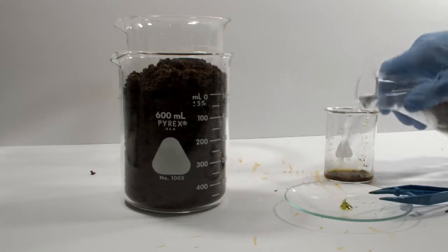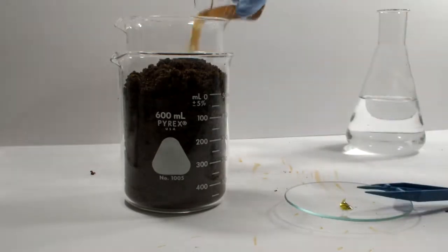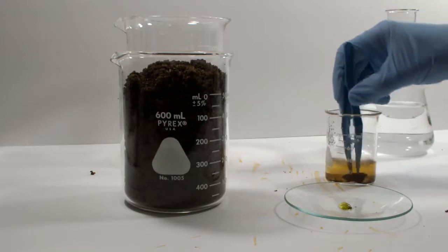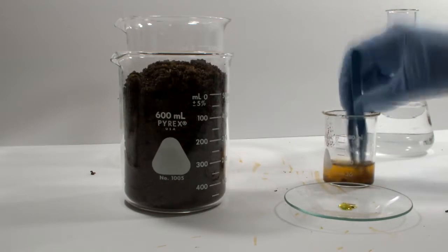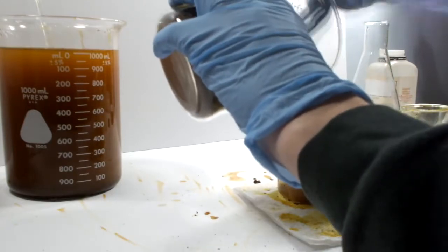This stuff is really soluble. I'm going to exchange the watch glass for a napkin, and I will spare you from filming the entire procedure. But eventually, I do turn this process into something that's relatively manageable. It's still a real pain, though. As you can see by my mess, I've been hard at work.